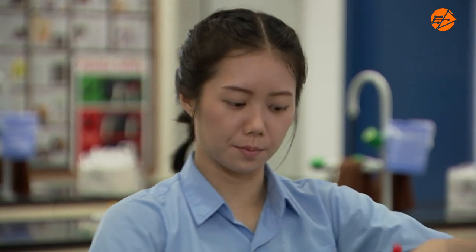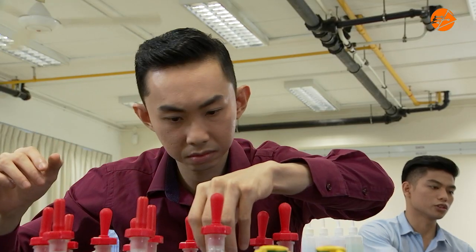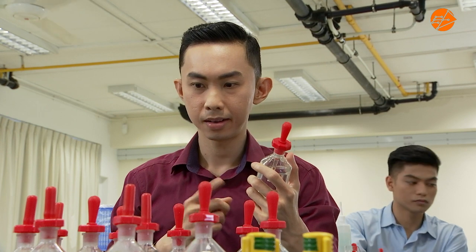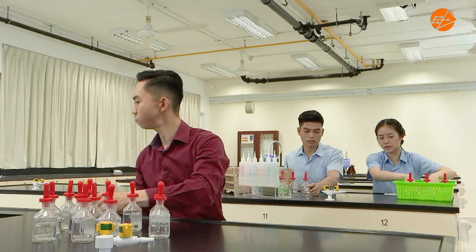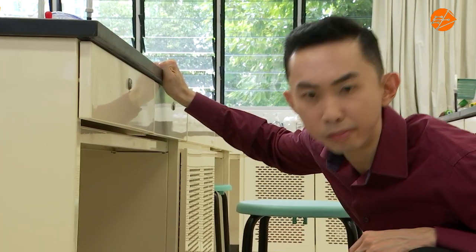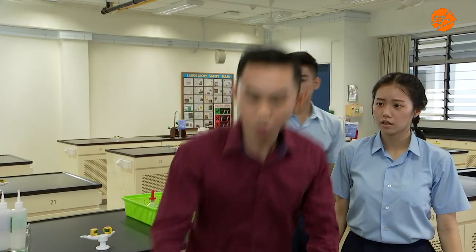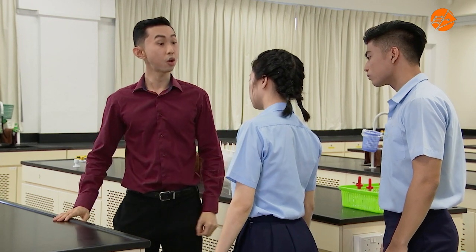I'm going to collect the calcium chloride bottles, not the zinc nitrate ones, okay? Where is it? This is a mystery. One of the bottles is missing a label. I need to figure out if this contains zinc nitrate or calcium chloride.